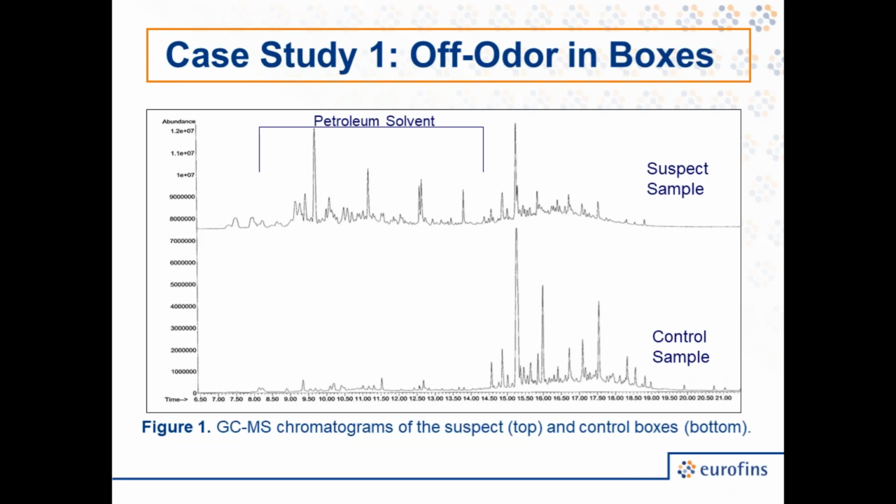But the important thing to note here is when we look at our suspect sample and compare it to the control, we can see the presence of a number of additional peaks early on in this profile, which I've indicated on this slide. These peaks were identified as low molecular weight hydrocarbons, which are indicative of the presence of a petroleum-based product.